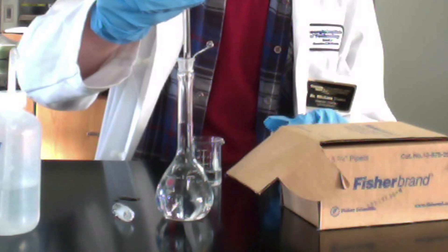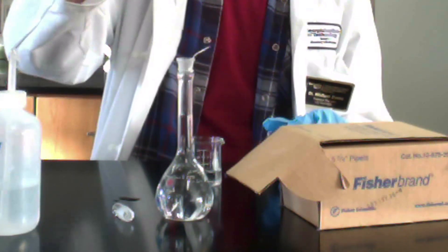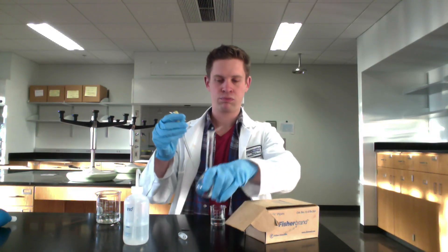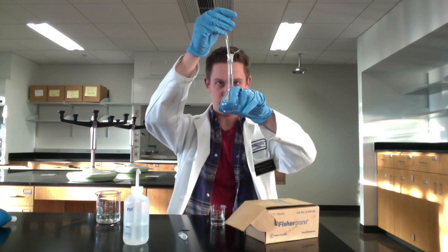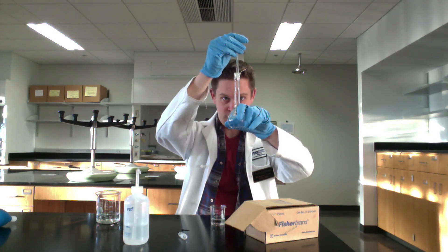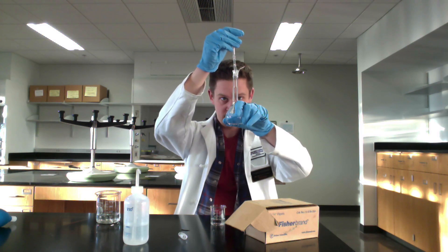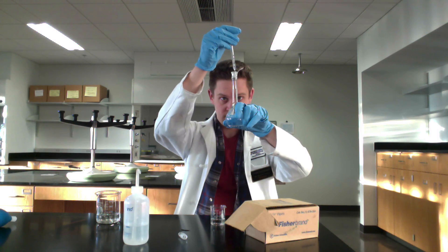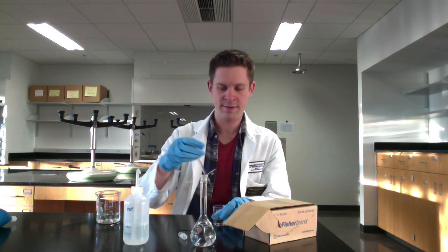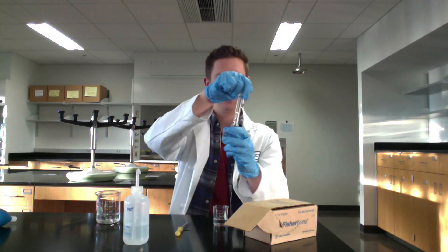Adding dropwise now — I like to add along the side to avoid splashing above the line. The liquid level is rising pretty fast; we're within about five milliliters of the marking. I can tell I'm going to reach the marking on this delivery, so I add it in and then do the usual business of looking at the bottom of the liquid meniscus, making sure the bottom of the meniscus just barely touches the marking. Then cap again and give it one more inversion since we've added a bit more solvent.